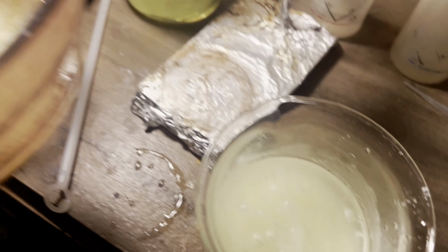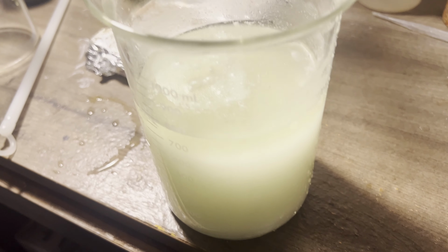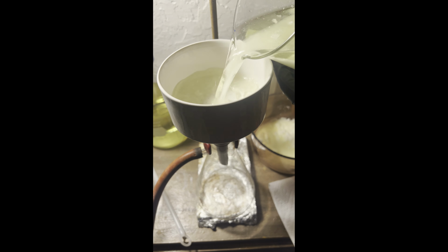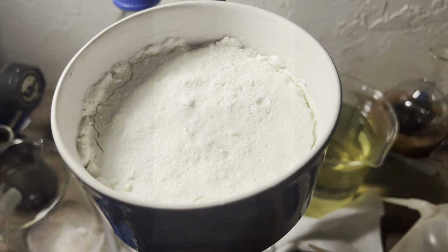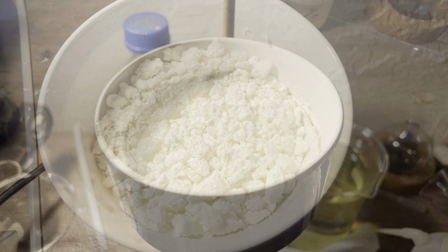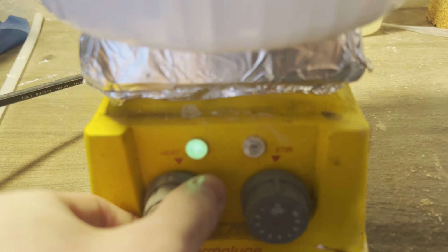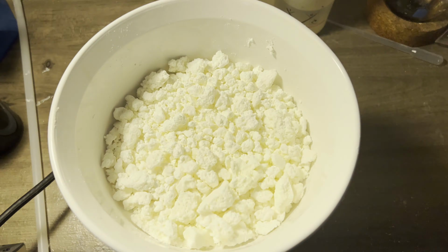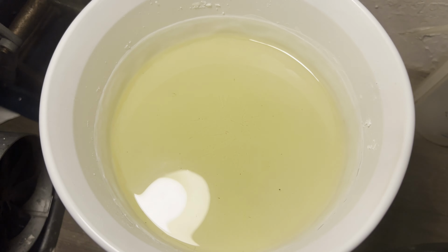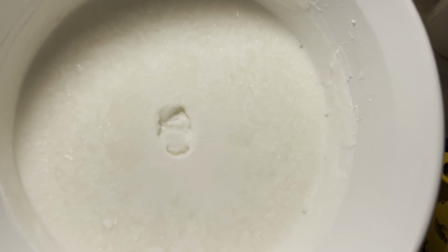This is very apparent by all of the solid fitting in this funnel. I did have to empty the filtering flask, since I wanted to wash the solid with water, but at least I didn't have to empty the funnel. I transferred the product to this ceramic dish and put it in front of my space heater until it dried. Once dry, I put the dish on a hot plate and cranked the heat all the way up to melt it. This is to remove water, if present, and anything else volatile.